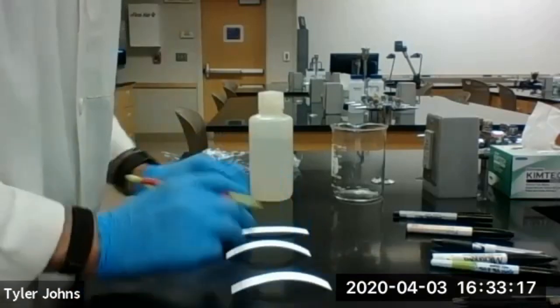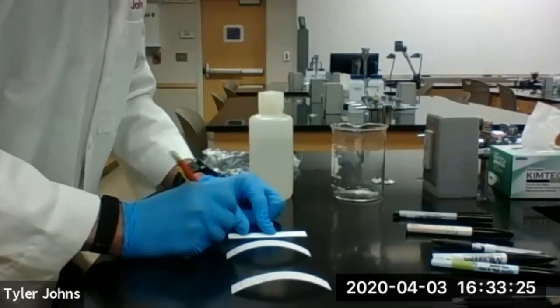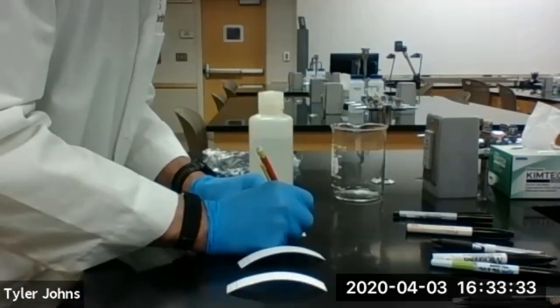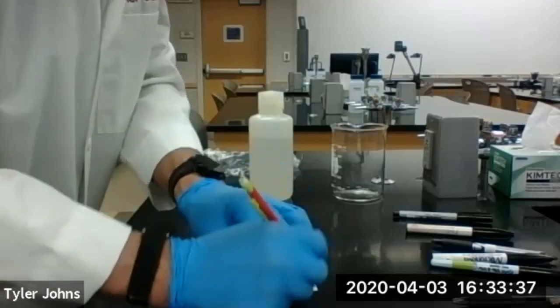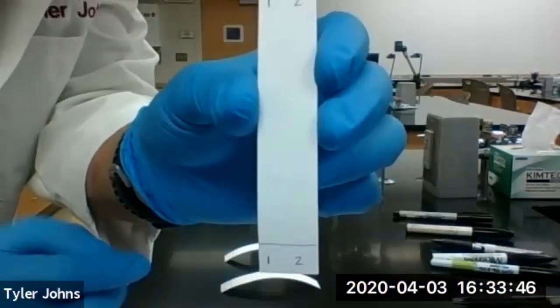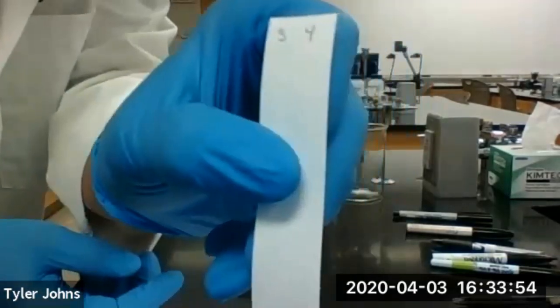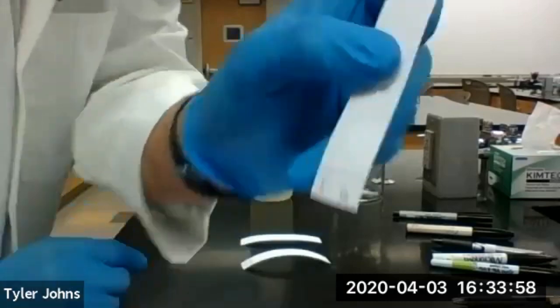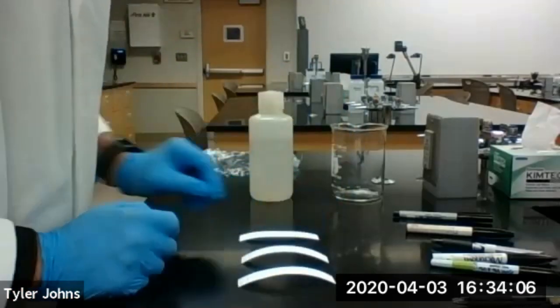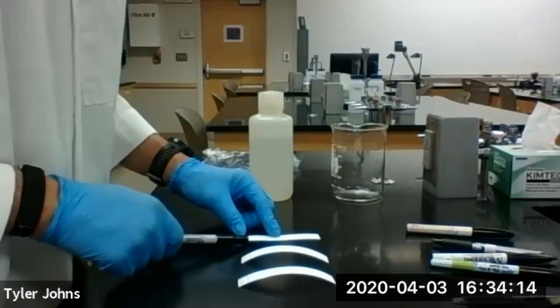At the bottom and at the top, I'm going to number our students' pens that are potential suspects. We have our chromatography paper with a line drawn one centimeter up from the bottom, numbered one and two on the first, three and four on the second, and five and six on the third. We can run two suspects' pens on one piece of chromatography paper. Now we're going to take our pens and spot them on the line one centimeter up.